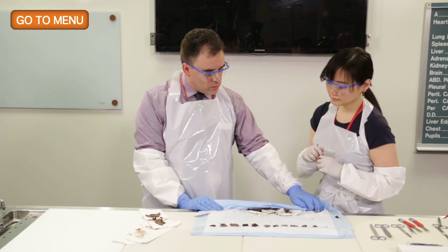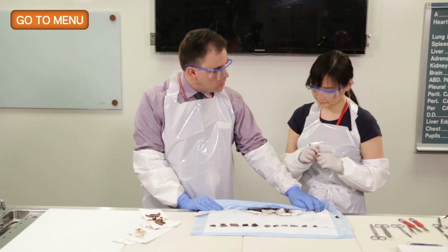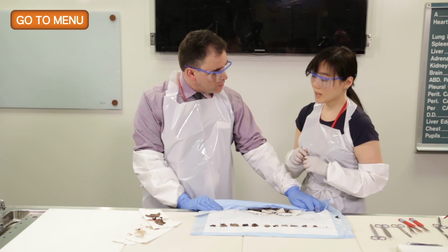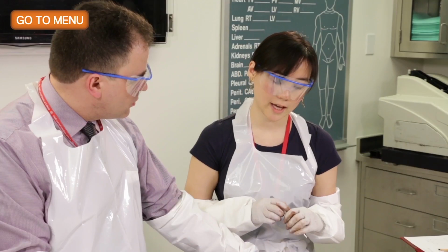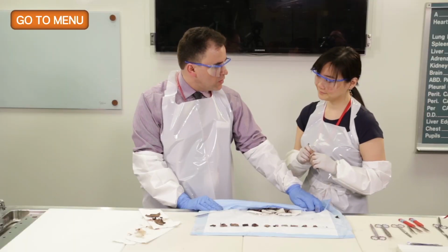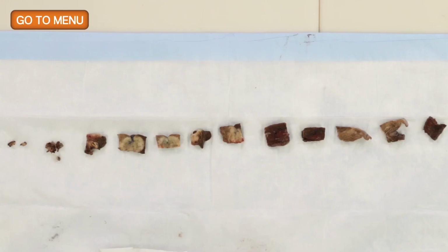And so just to go back to lymph nodes for a moment, did you bisect any of the lymph nodes? I did not. And do you estimate a number that you found? Yes, we have 3. And so both those things need to be in the gross description so that we can reconstruct an accurate count of lymph nodes.